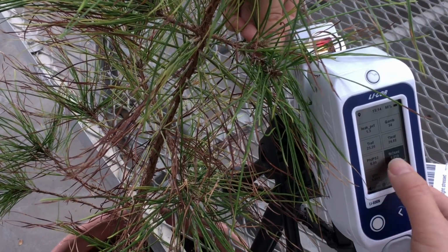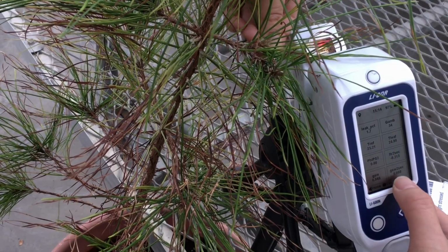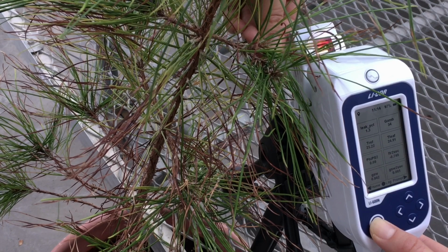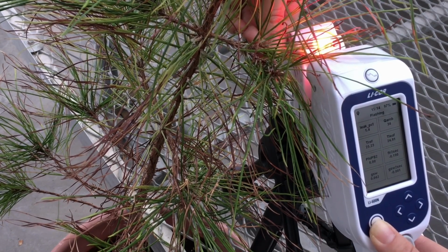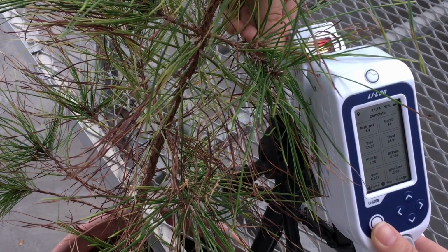When you don't see black boxes over here for the slope numbers, you can press the Enter key to log the data. Now one measurement is finished.